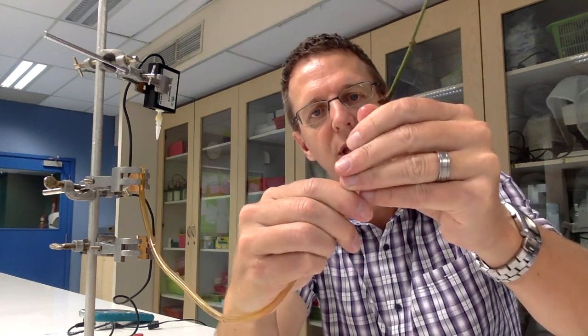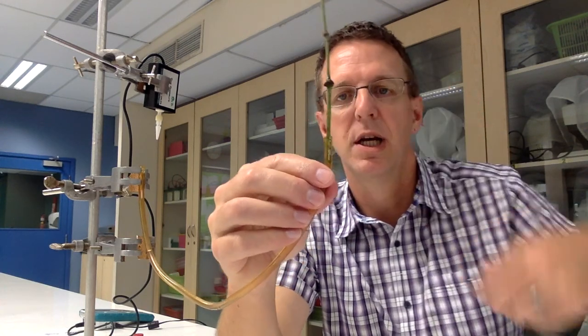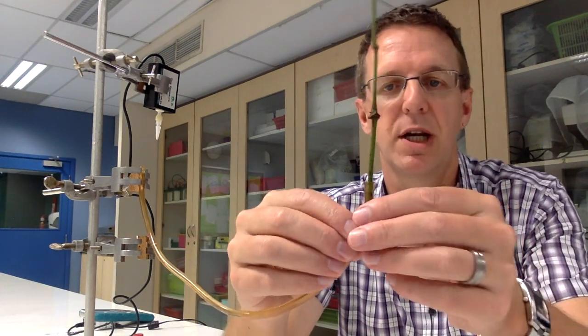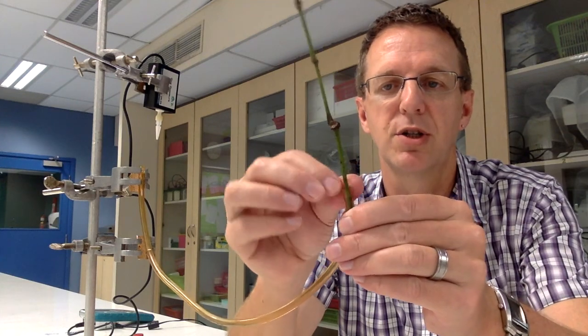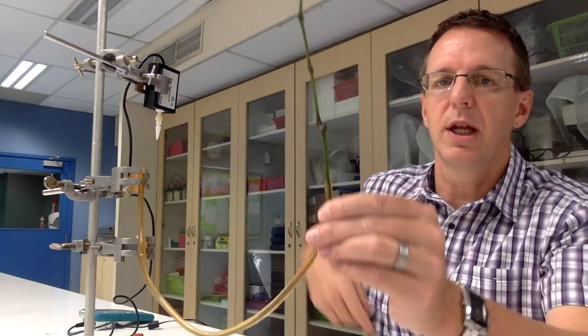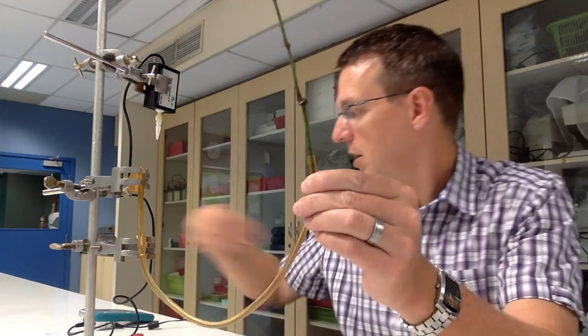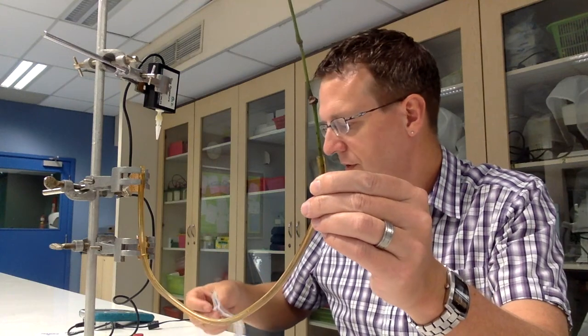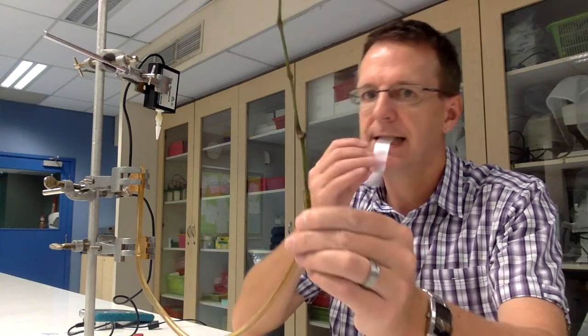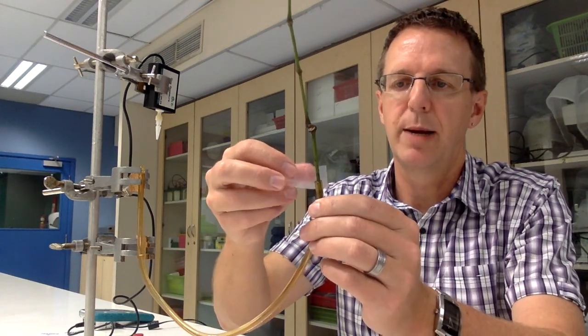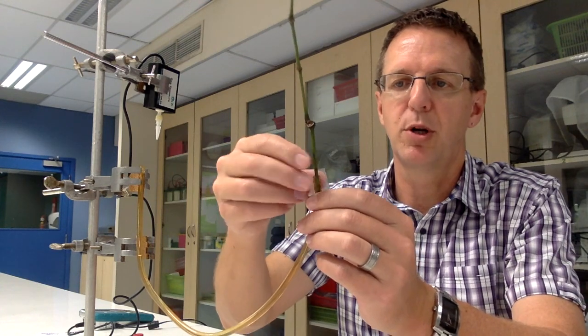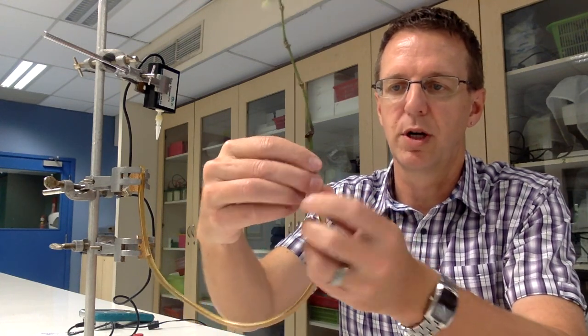Okay. That's in there. It's in there pretty tight. The key to this is that it has to be an airtight seal. Now, what I would do at this point then is to dry off the tube. And then take some parafilm and wrap it around the tube. Now again, it's going to have to be pretty dry in order for this to work.